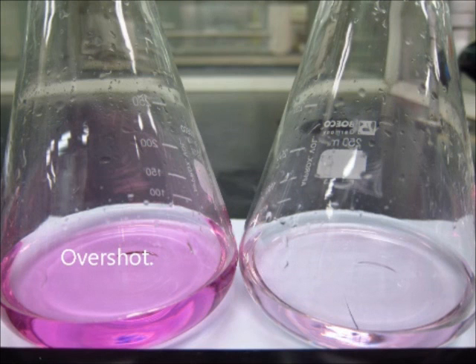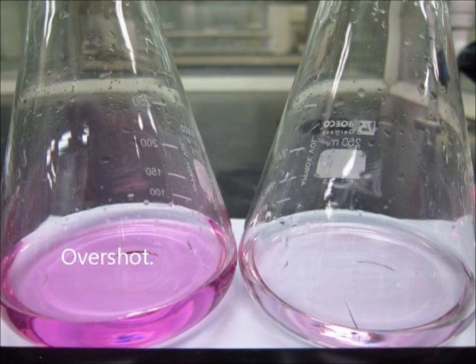On the left conical flask, you see the effect of spamming, overkill. It's just too much base added. You know, you get a dark pink.